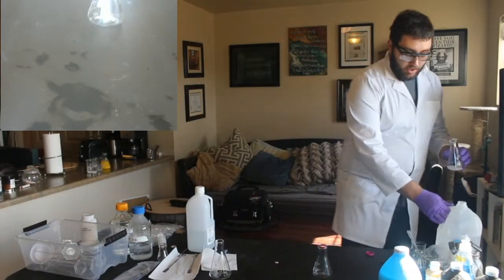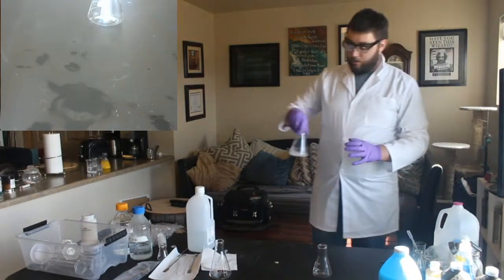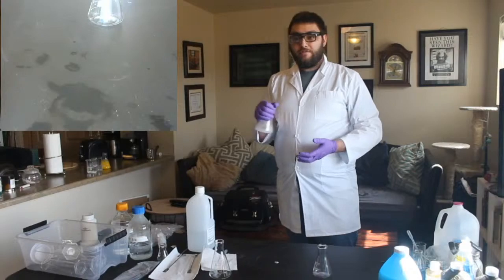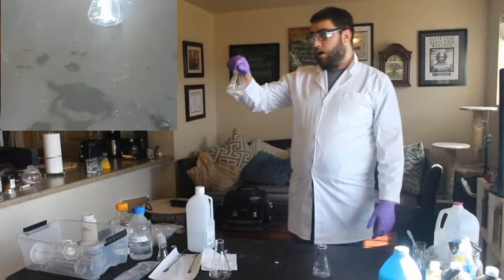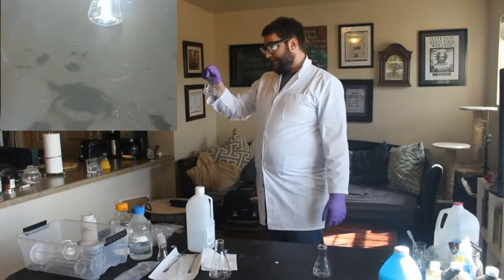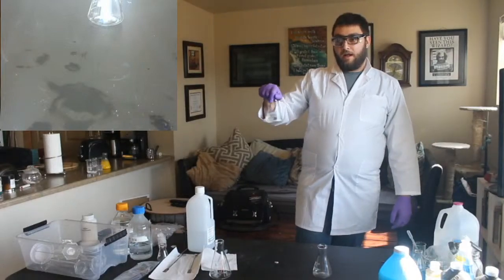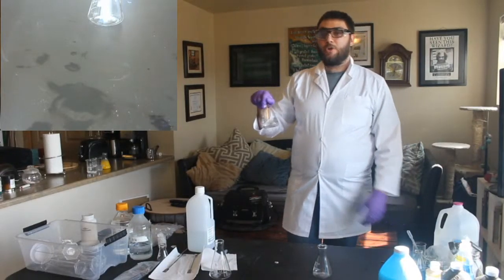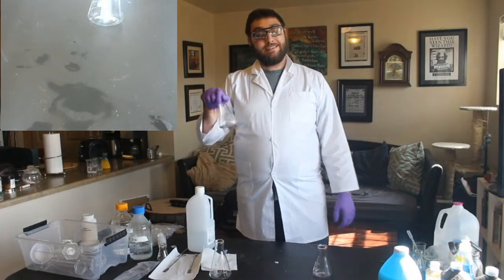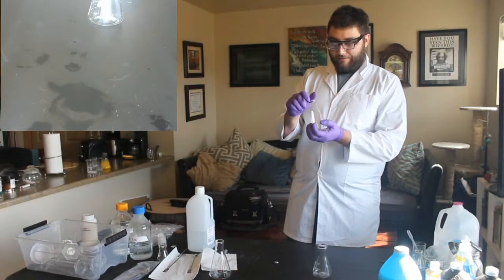And we want what's called a supersaturated solution, which means we want more of this dissolved in our water than is allowed, because the more that we dissolve, the more the reaction goes. When I say is allowed, I mean is allowed at the temperature that it is without any outside influence.